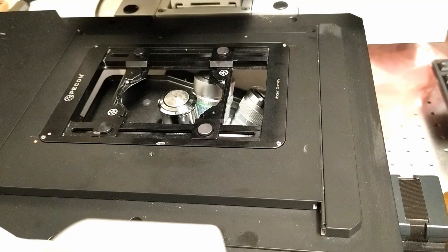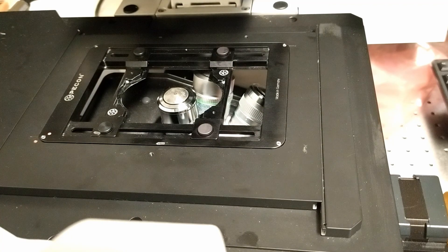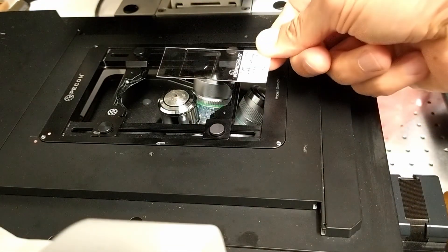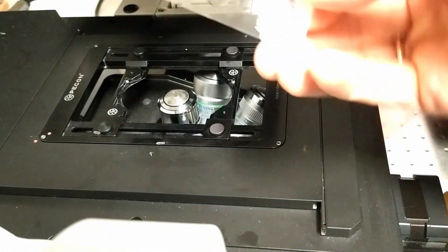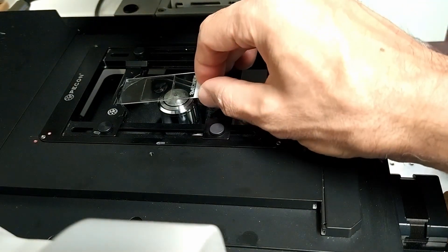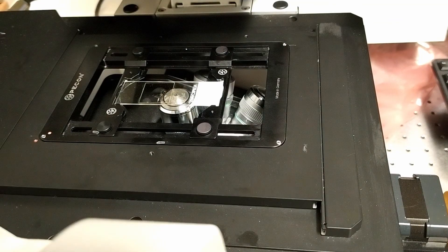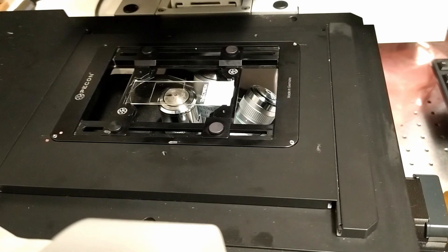Just like with the confocal microscope, we need to make sure the objective is in the lowered position. Adjust the holder if necessary, then grab the sample — in this case, cells grown on a coverslip and sandwiched to a slide. Turn it over because it's an inverted microscope, and place it on the holder.